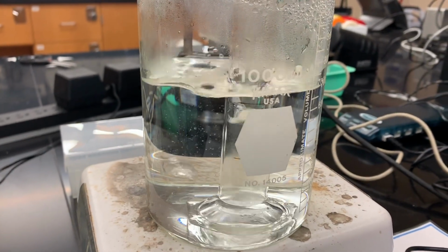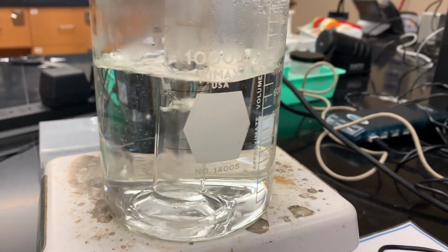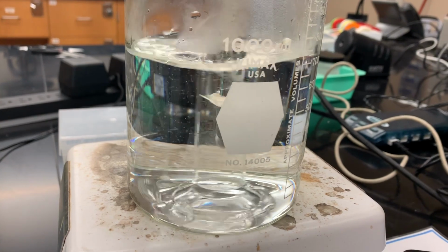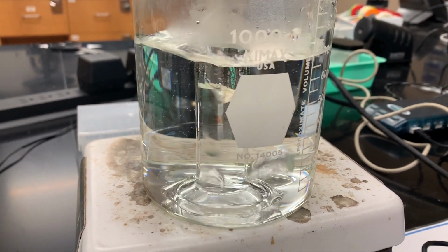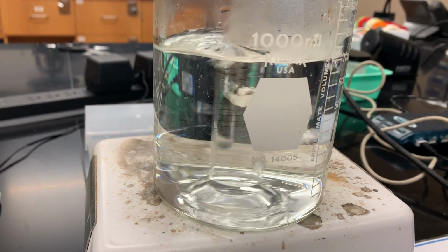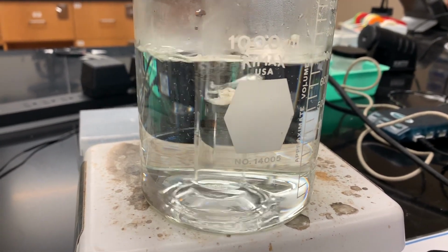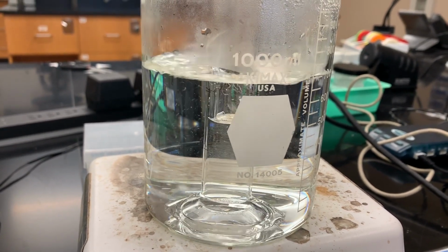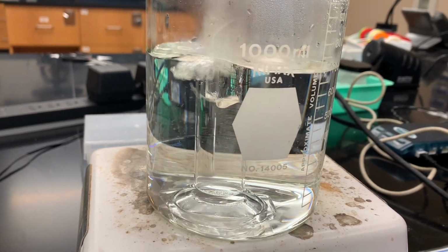Okay, so it's almost all dissolved. I'm stirring it with a stir rod here to get all the potassium nitrate dissolved in solution. So it's almost there. Okay, so once it's all dissolved, I'm going to pull it out and record the actual volume. So it's going to be greater than the 9 mL of water I added, because I had, remember, almost 12 grams of potassium nitrate in there as well.